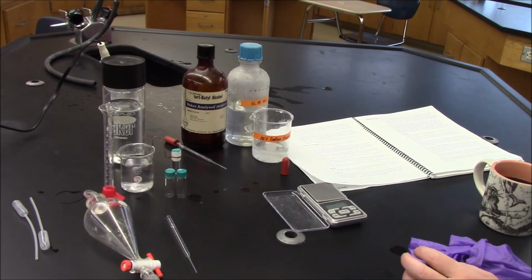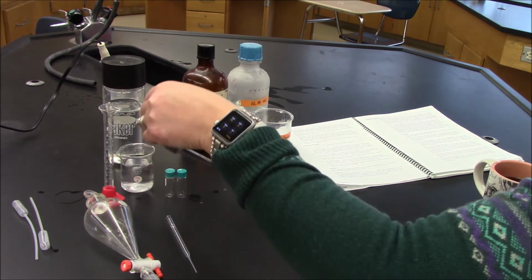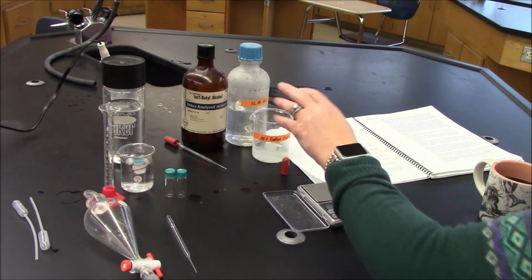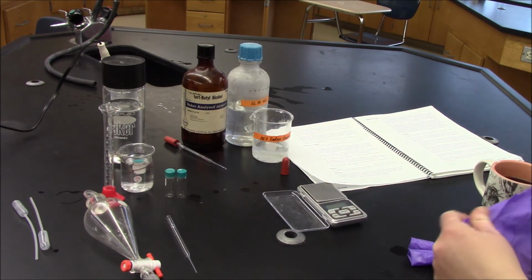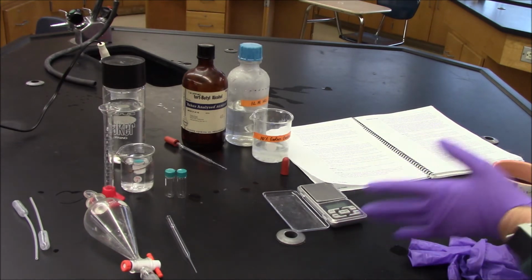All right, it's been at least 20 minutes. This has been allowed to sit and cool, so now I'm going to put it in my ice water. I had some deionized water and put it in the fridge overnight. Now it's 4 degrees Celsius, so this is my ice water. I just set a timer for 3 minutes.